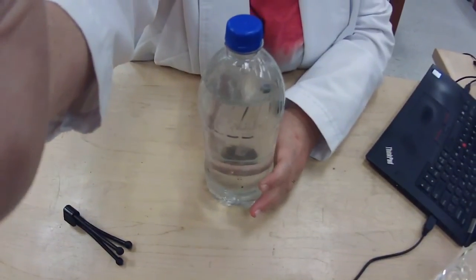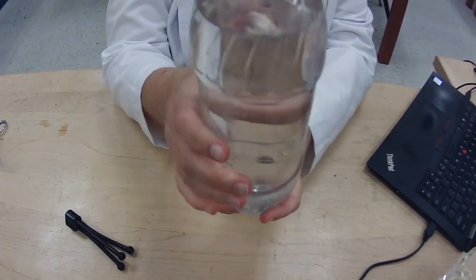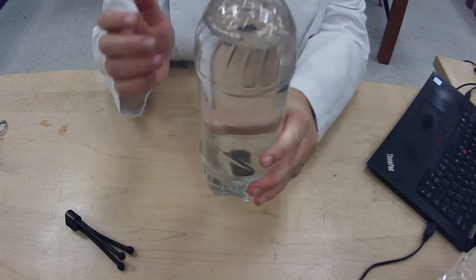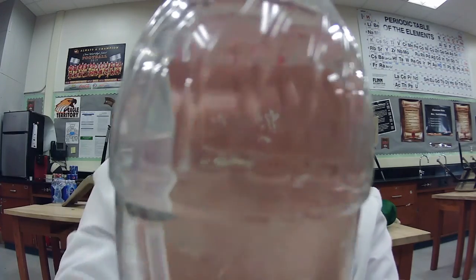So I'm going to point this down a little bit. I'm going to see if you guys can see this. Hopefully you can. Maybe we should get a little bit different angle. All right, let's see if we can get this to work. So here we go.